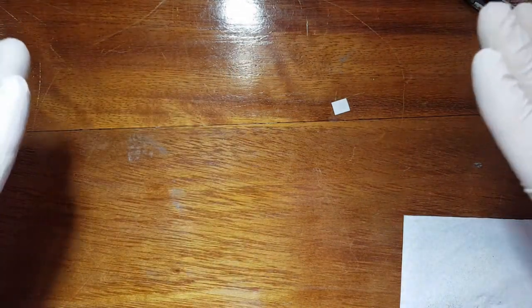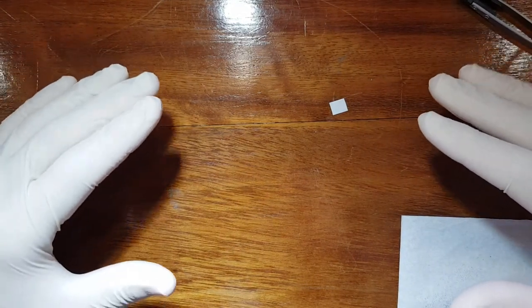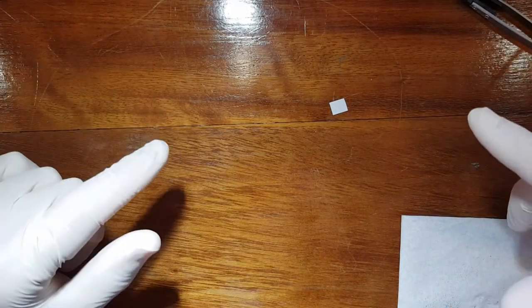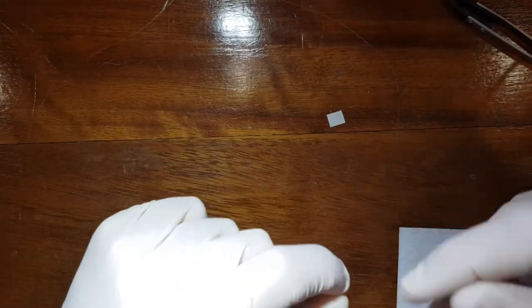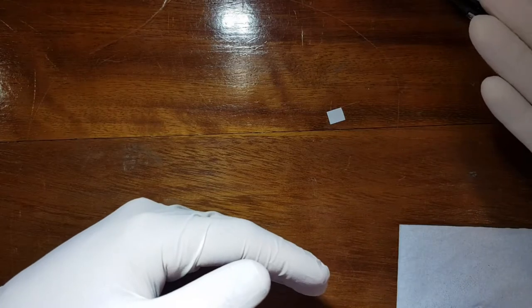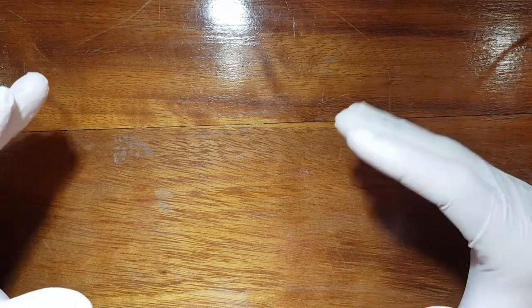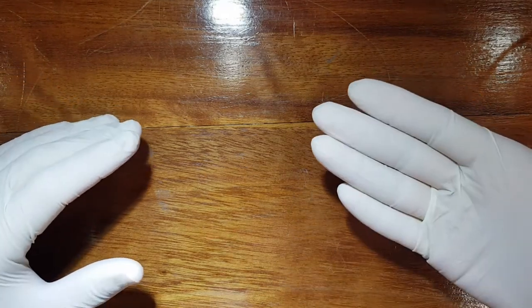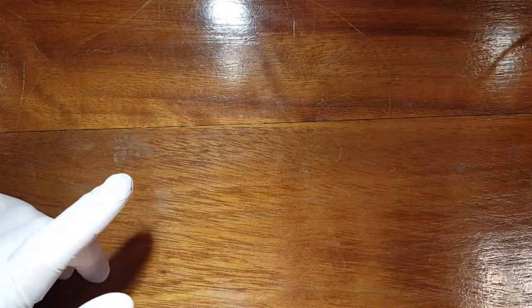Paper towel here to minimize any spills. We'll just clean up this table and I'll get to the second part of the video where we'll be cleaning off a sample holder so we can store it in our samples ready to be prepped again in a future instance. Now after you've removed the sample from the XPS device we will need to remove the carbon tape that was attached to it and the sample that was mounted on it.